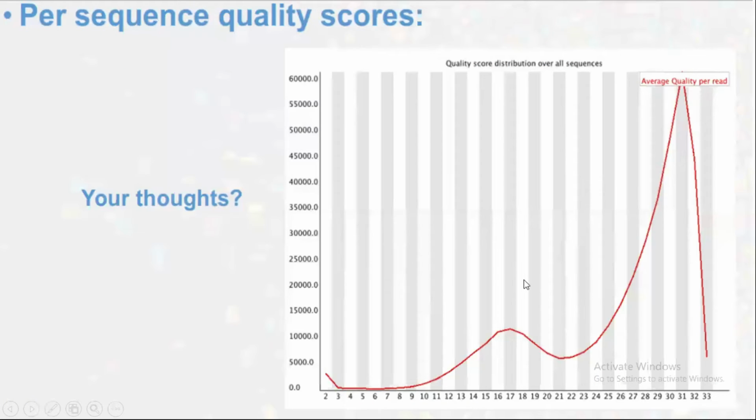What about this one? This is also a per sequence quality score. Now we have some sequences that have an overall quality between 10 and 20, and between 10 and 20 is not good quality. About 15,000 of our sequencing reads have a quality between 11 and 20. So this is an issue, and you have to deal with it.